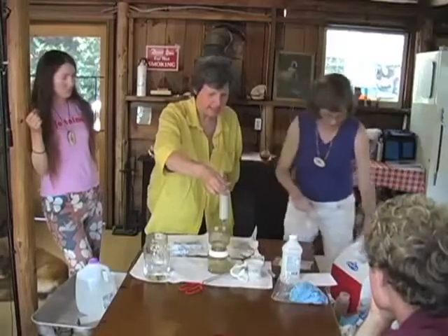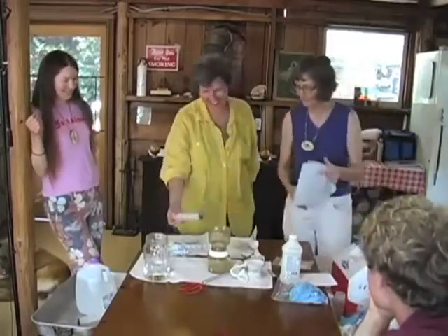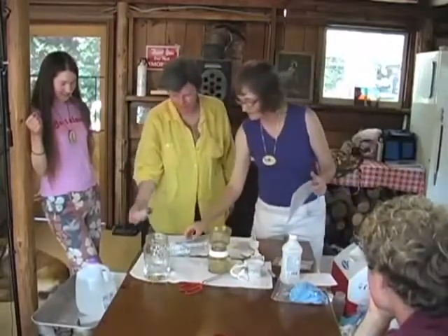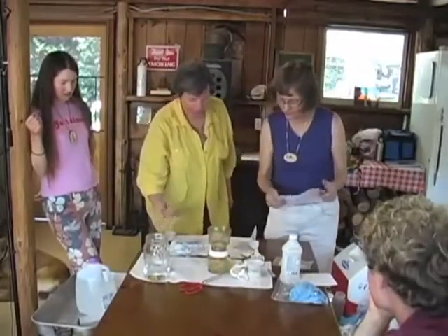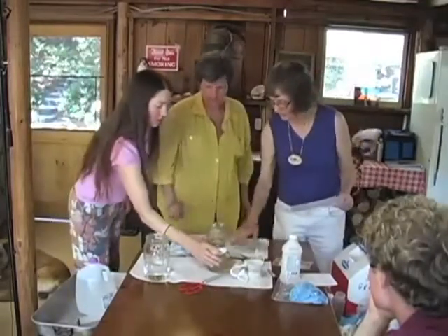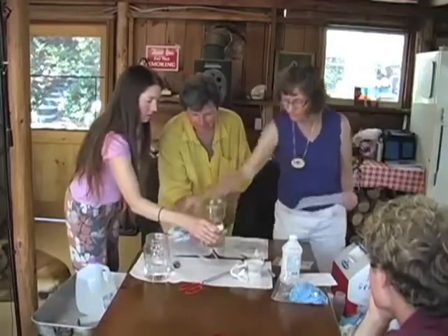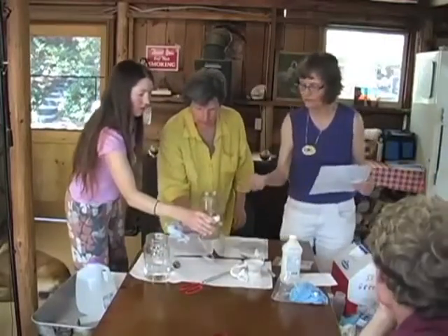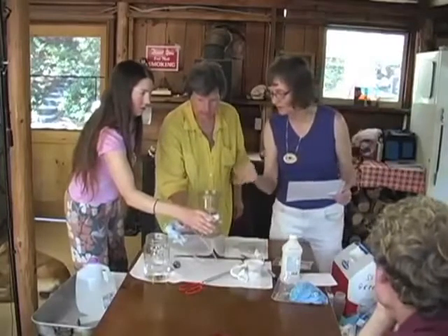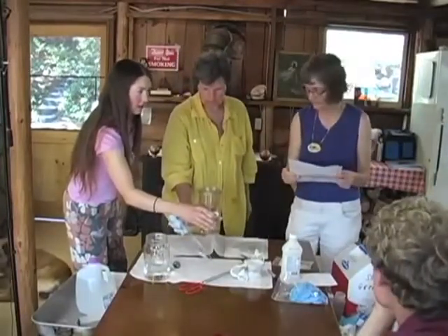It's like baking muffins. Yeah, it's a cookbook, it really is. Okay, so let's keep that clean for now. Okay, and you're swirling it. Yeah, so one of you swirl and one of you pump. And part of that is so if you have any particulate, you're trying to kind of ease it down gradually, so they don't stick to the side. And once it gets dry, we don't want to keep going, so we stay in the solution.